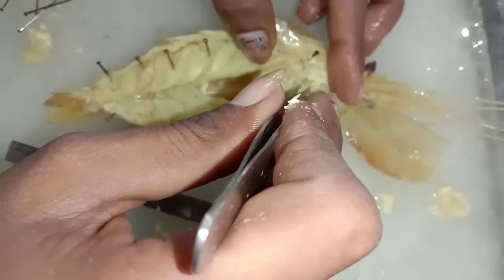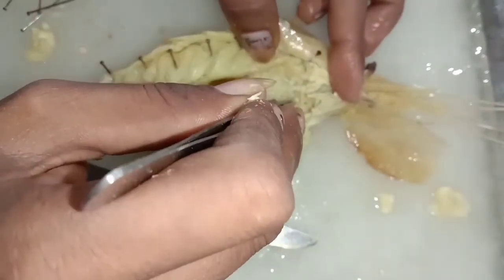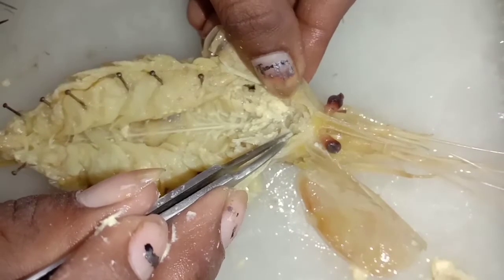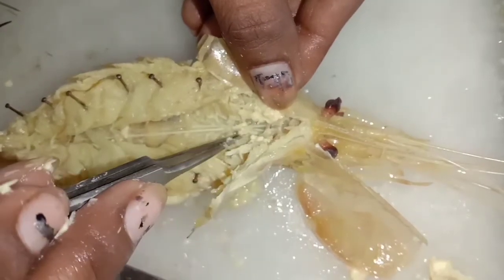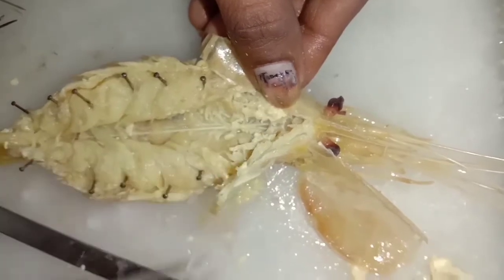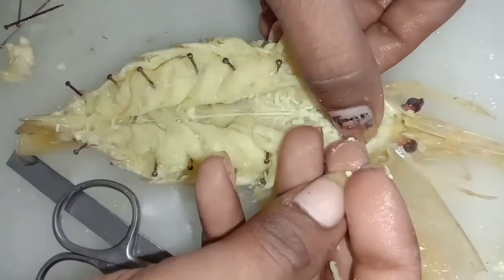Clean the ventral thoracic ganglionic mass.